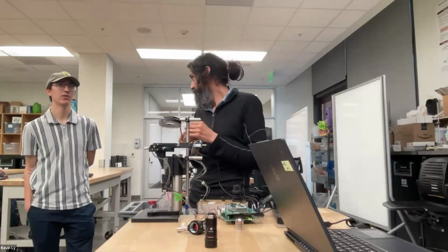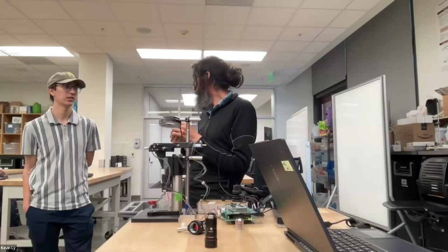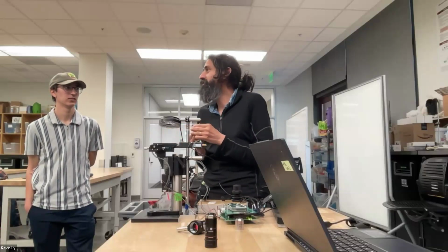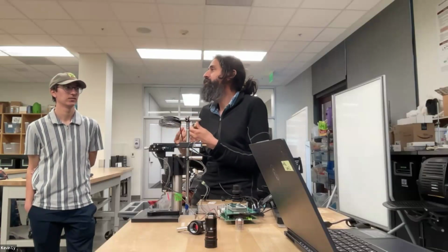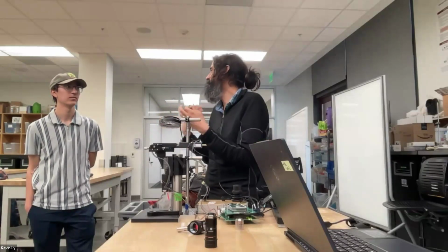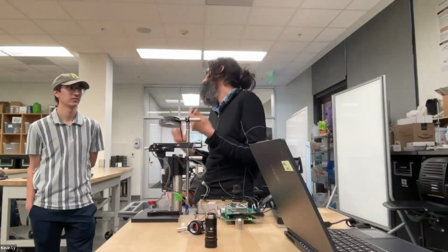So how much? Oh, sorry, you go first. Man hours depend on how precise the objective is. And because it's an art, people are like, oh, this is a Nikon objective or an Olympus objective. There has been branding.